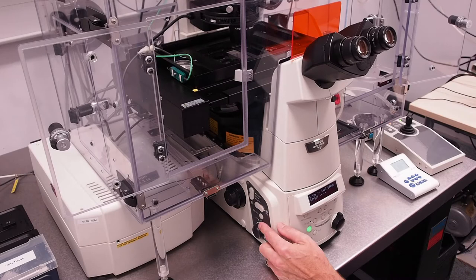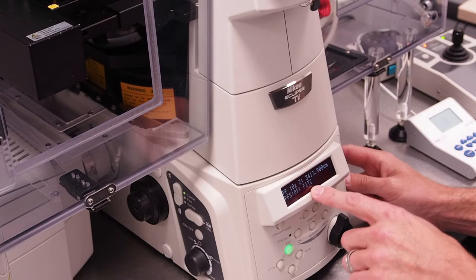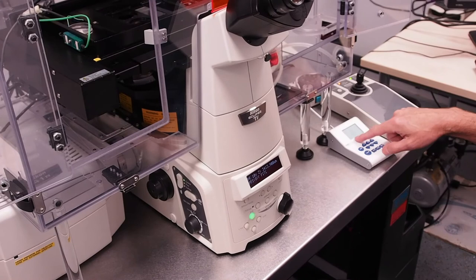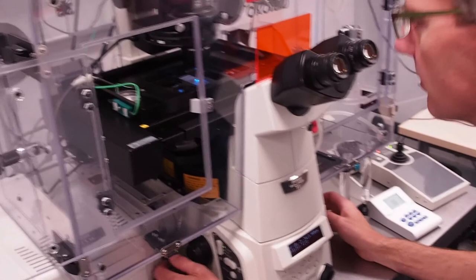If you want to locate your sample using fluorescence use the filter select buttons on the right to rotate the filter wheel to a suitable cube such as FITC as shown on the LCD screen. For excitation use a cool LED control to switch on the correct wavelength of light choosing UV blue or green. Here we're using the FITC cube so require blue excitation light. Ensure it is selected and press on to switch the LED on.